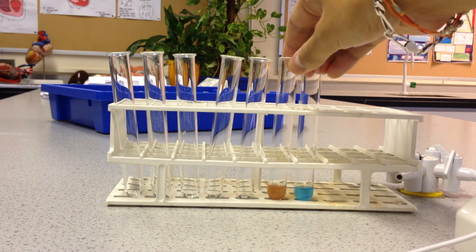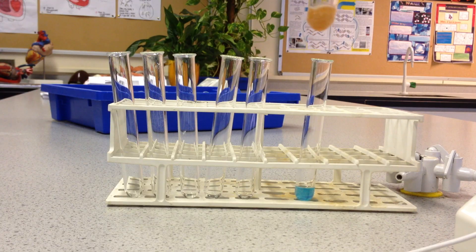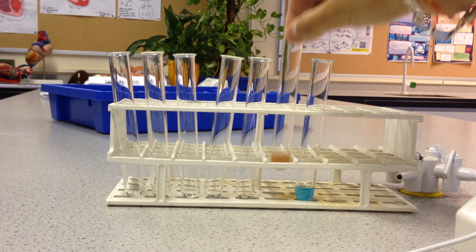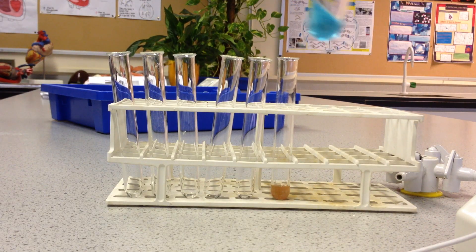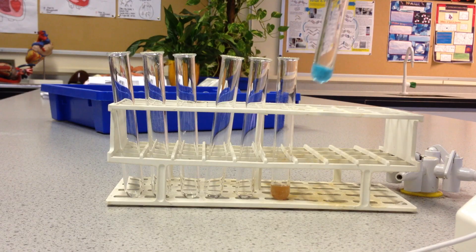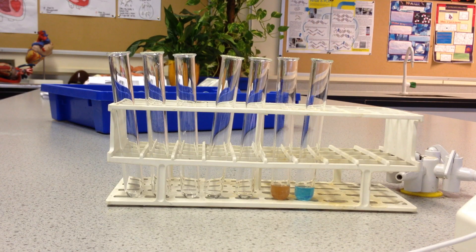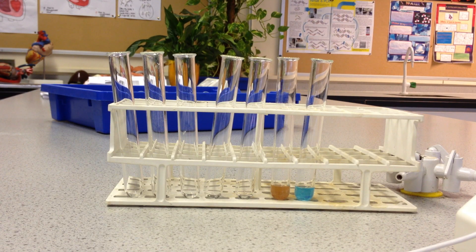After about five minutes you can see that when the glucose was present, a nice brick red precipitate has formed. And where we just used water, there has been no colour change at all. So that's the straightforward Benedict's test to check for the presence of a reducing sugar.